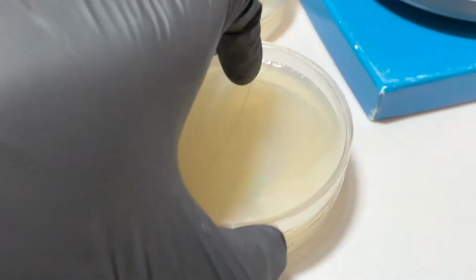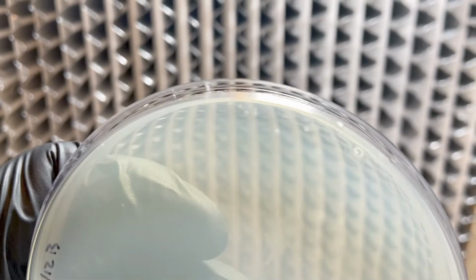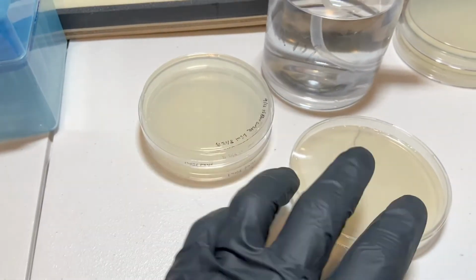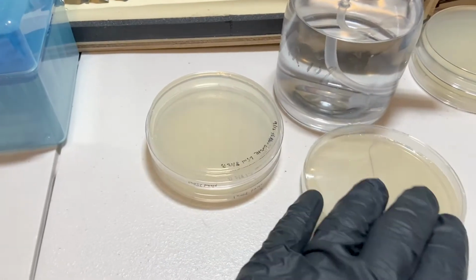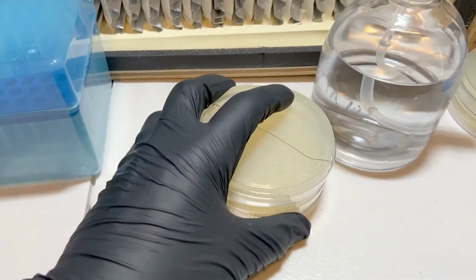But what's more telling is looking at a different plate, such as this one, which shows a lot of colonies, right there along the edge. So the question is, why do I keep getting all of these colonies along the edges? And to me, there are really two obvious choices that jump out.